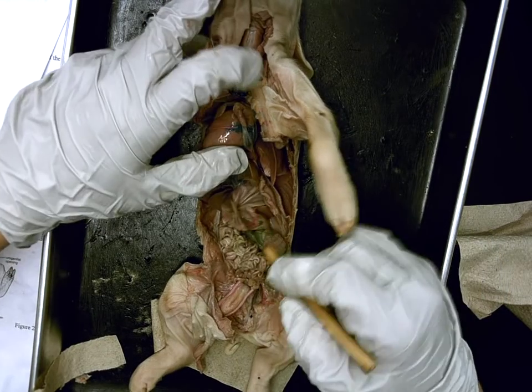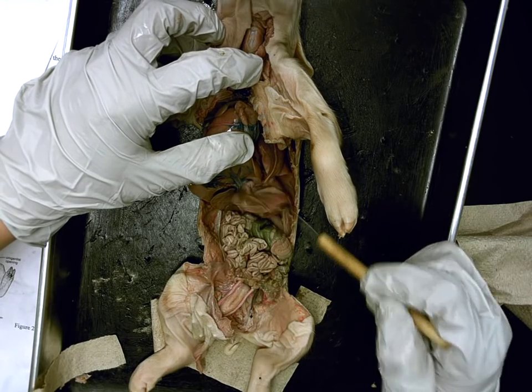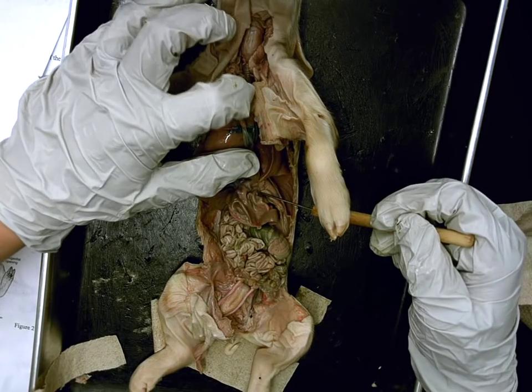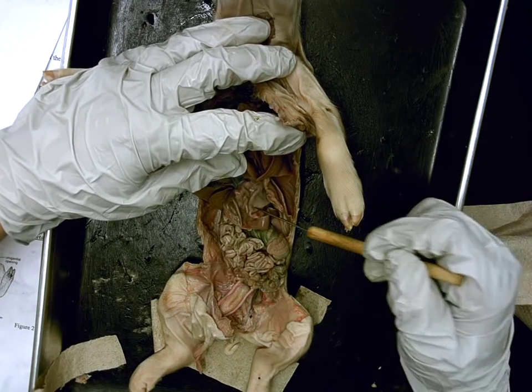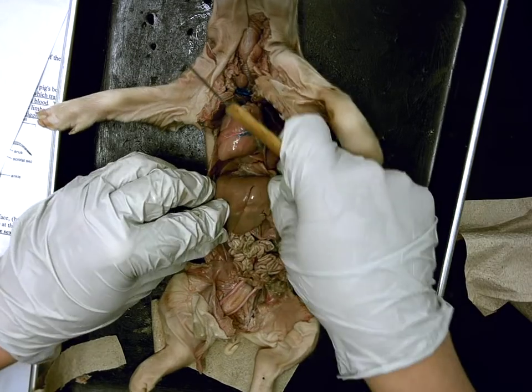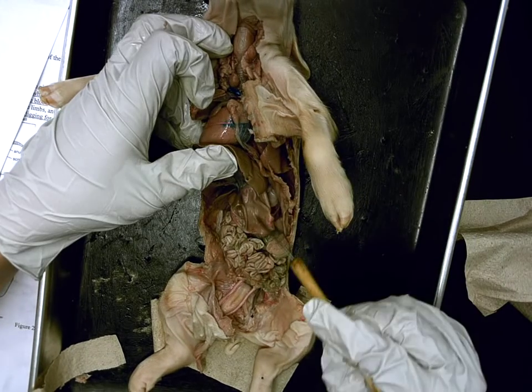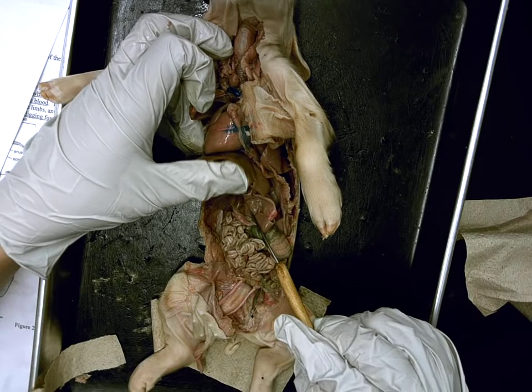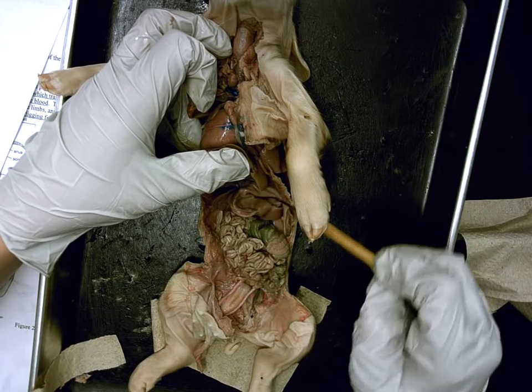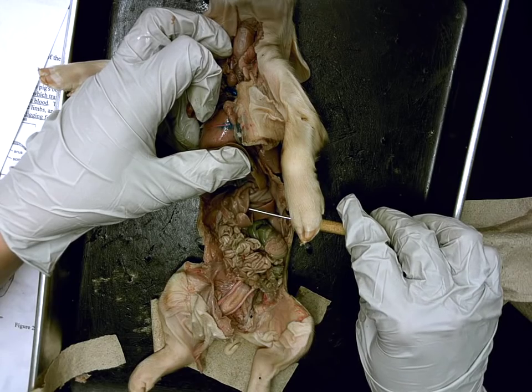If I then pick up the liver, there is this deflatable pouch — it's a deflatable pouch. What would this big, huge pouch be? The diaphragm would be above the liver — it would be this whole thing sitting on top of the liver. It's just a little deflatable pouch sitting underneath the liver. The stomach. Function of the stomach, and what kind of digestion will occur in this single stomach? Mechanical and chemical. Correct.